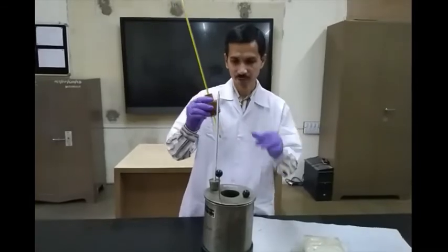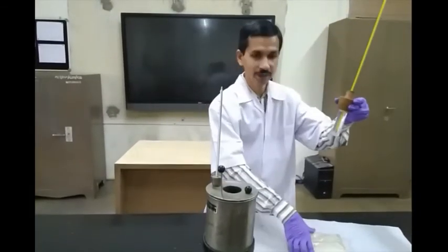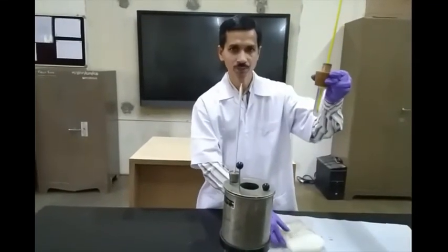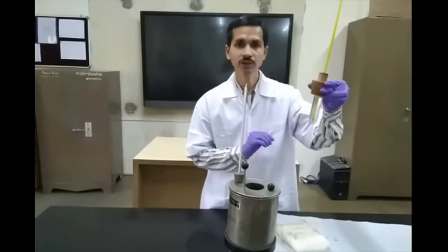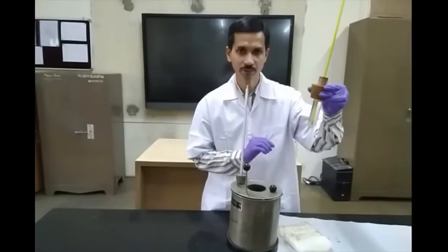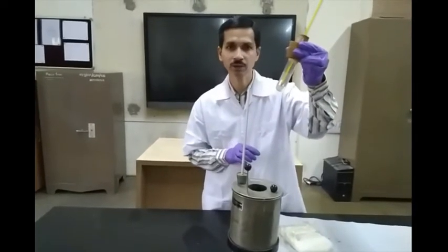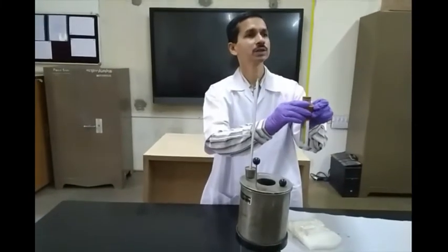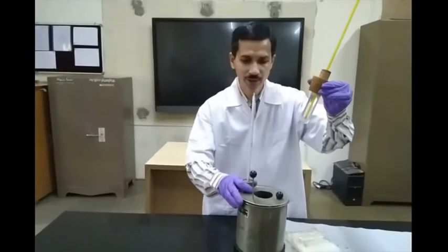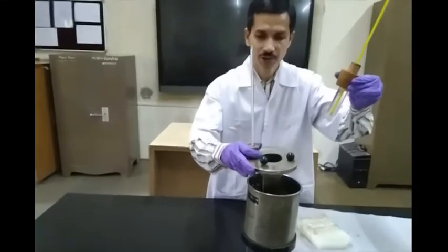So how do we get the melting point of wax? For that we have this apparatus. First, we take the solid wax, which is placed in a test tube and melted above its general melting point — around 8 to 10 degrees above. We have already molten this wax in the water bath and the temperature now is around 85 degrees Celsius. This is then kept in a water bath.